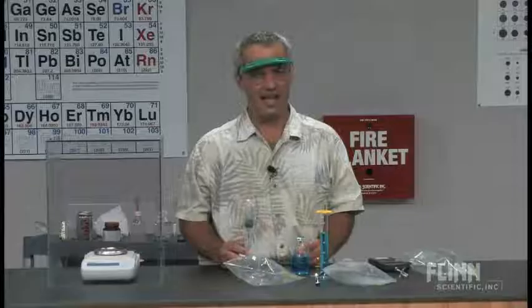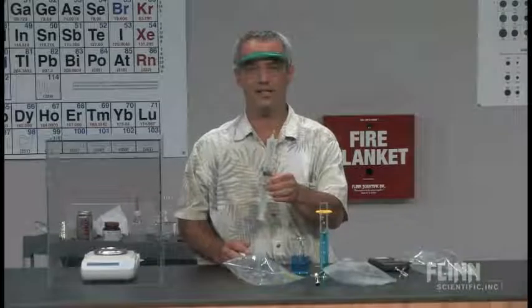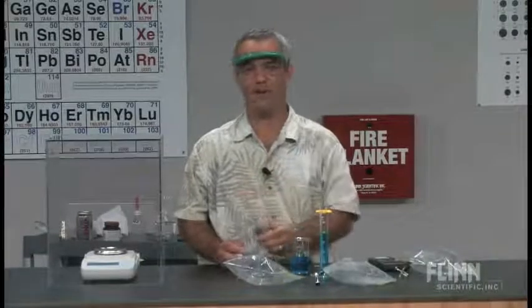So a nice little demonstration of how to determine the density of gases using a syringe and a milligram balance. Thank you.